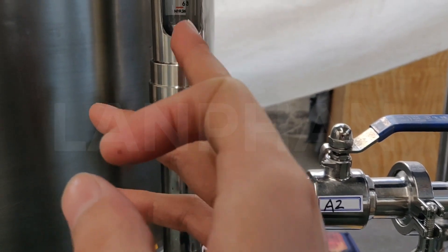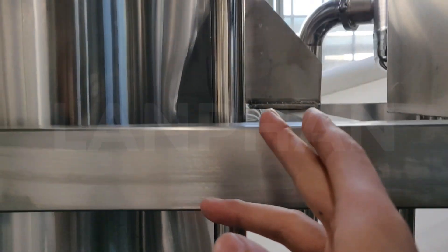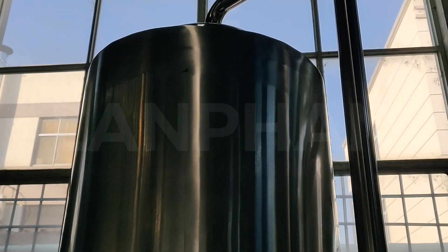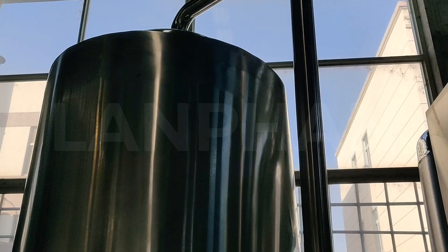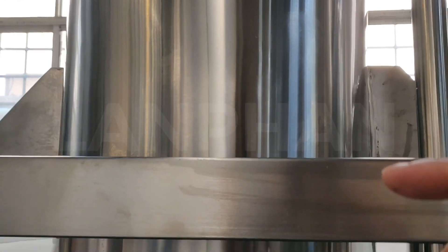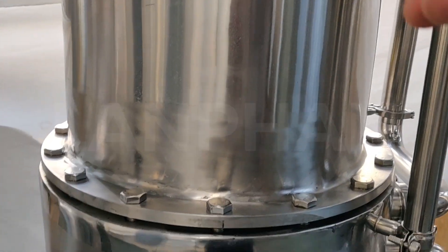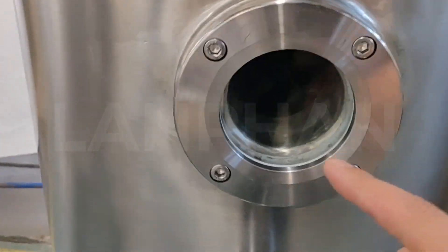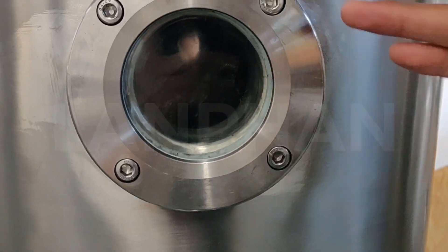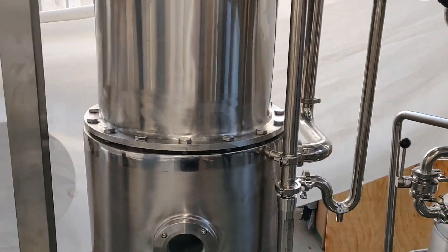We open the valve and connect the port to the raw materials. The liquid solvent will come in under vacuum condition, travel up through this pipe to the top of the tank, and then the solvent will fall down naturally and come into being a film. We can see from this window the liquid flowing down — that's why we call this machine a falling film evaporator.